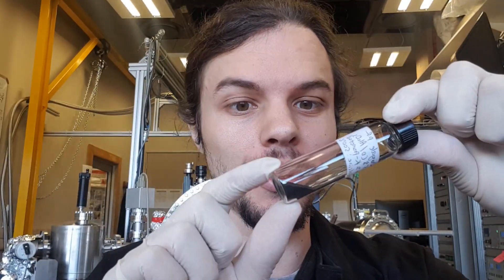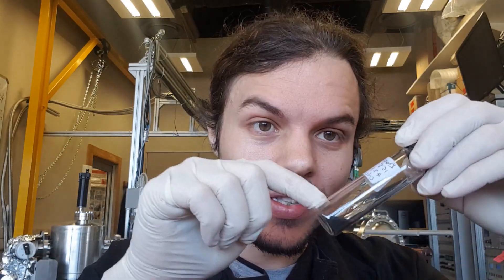Now I hope you found that at least somewhat entertaining and insightful. I should also mention that I used the word sample way too many times in that section. It's actually a sample holder. The real sample is this, see, that's an actual sample of powder of some composition.